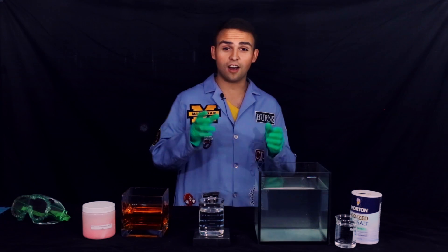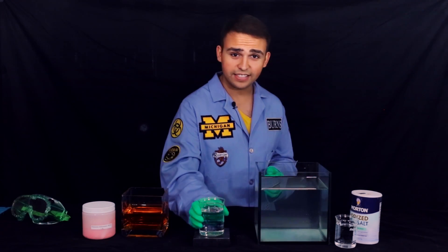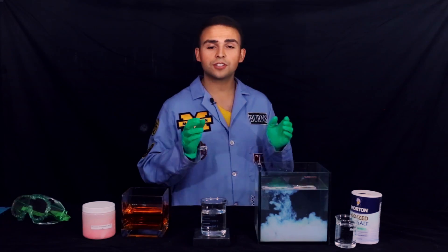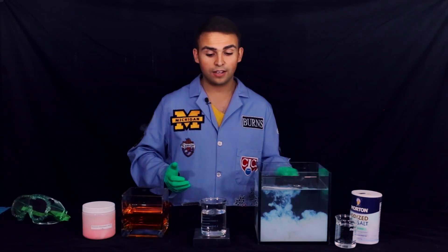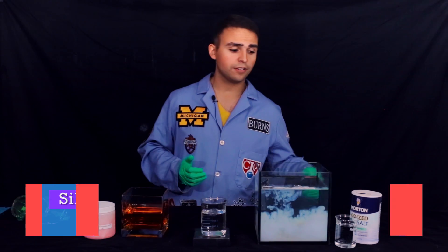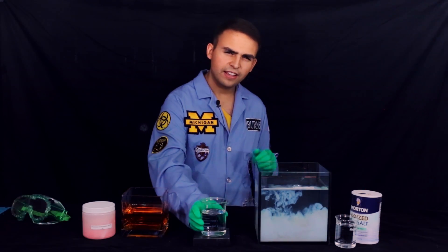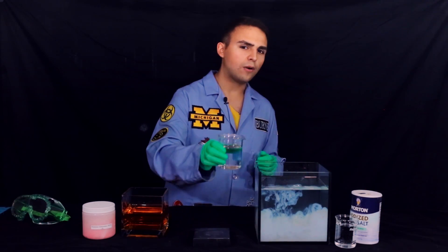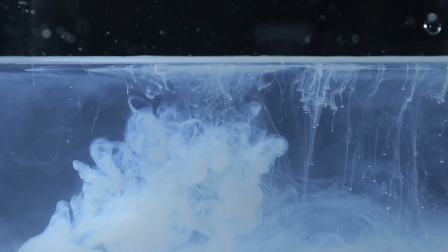Precipitation reactions are really cool. Take an example. I just combined two soluble inorganic compounds — one being silver nitrate, the other sodium chloride. When I mix them together, it appeared as though I've just created something from nothing.